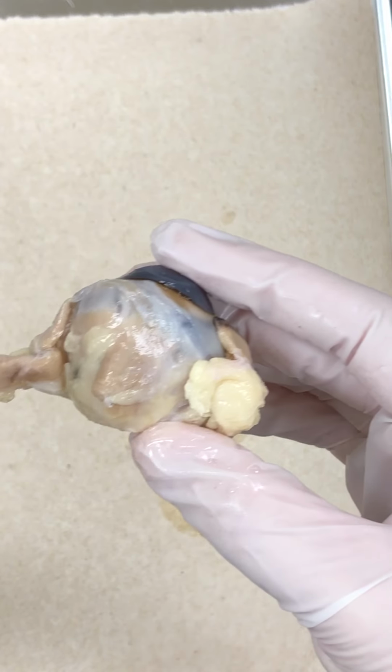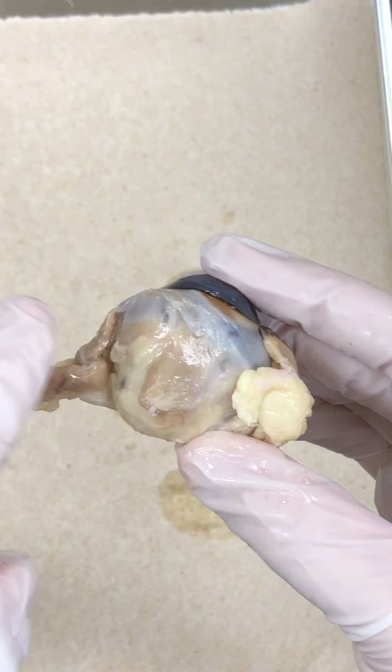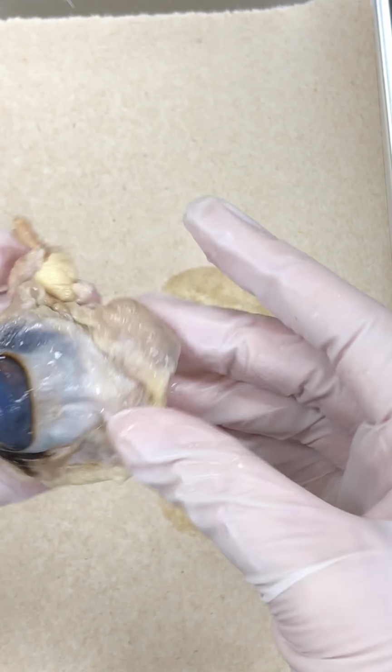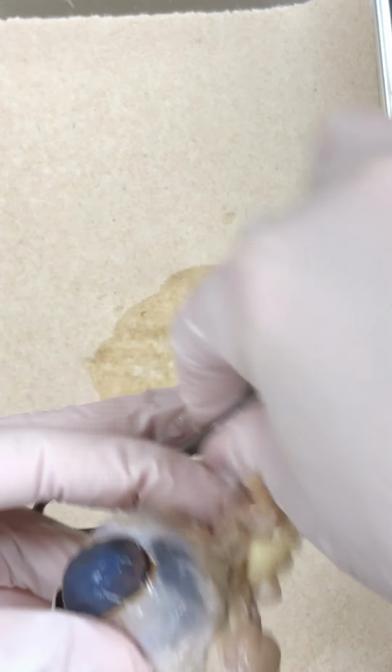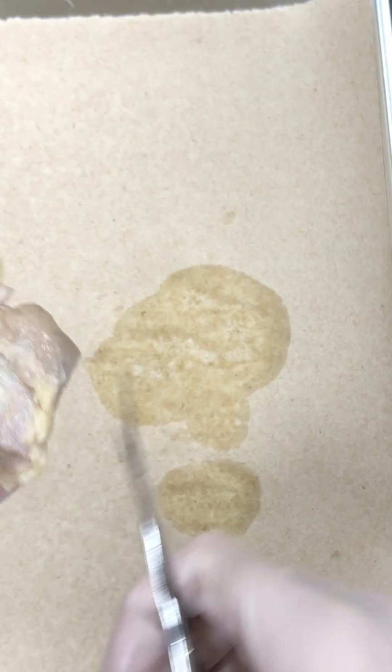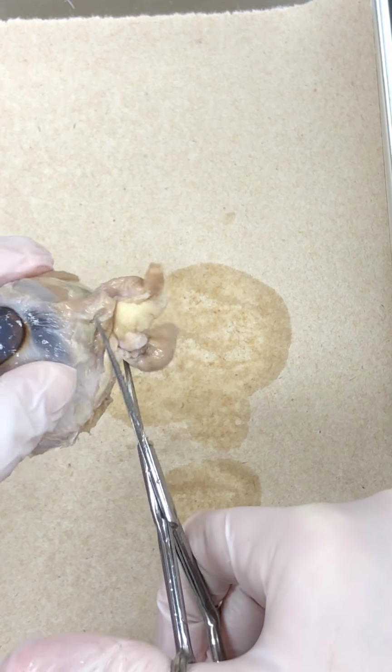And then we have the brownish structures there. That's going to be our muscle tissue. So we can see the muscles attaching to the eye. Sheep eyes have 4 extrinsic muscles, skeletal muscles, and in humans we have 6. So if you remember from your packet, we have 6.